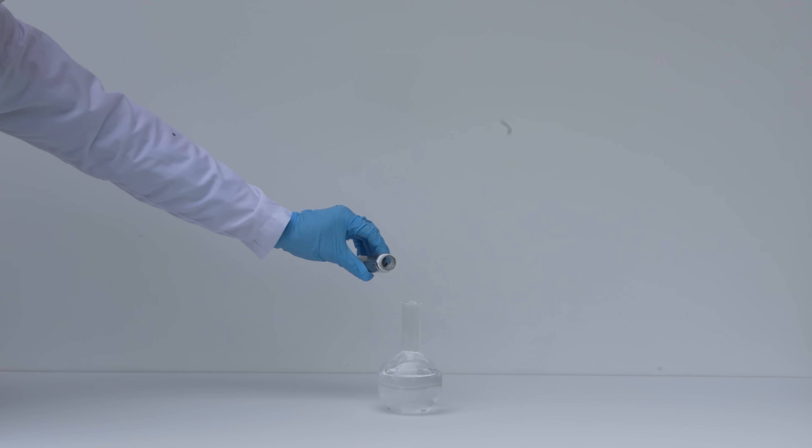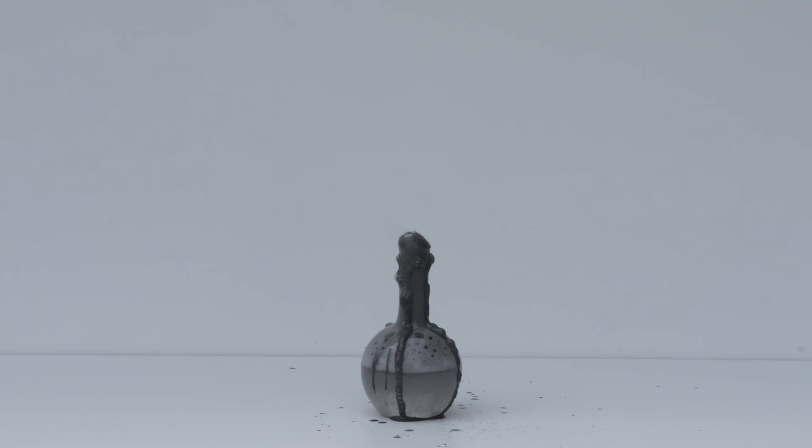And now, let's see what happens if instead of using ozone gas, I add liquid ozonated oxygen to the phosphine that's being released. I'm just going to pour a bit of liquefied ozonated oxygen into the flask where the aluminum phosphide is reacting with water.